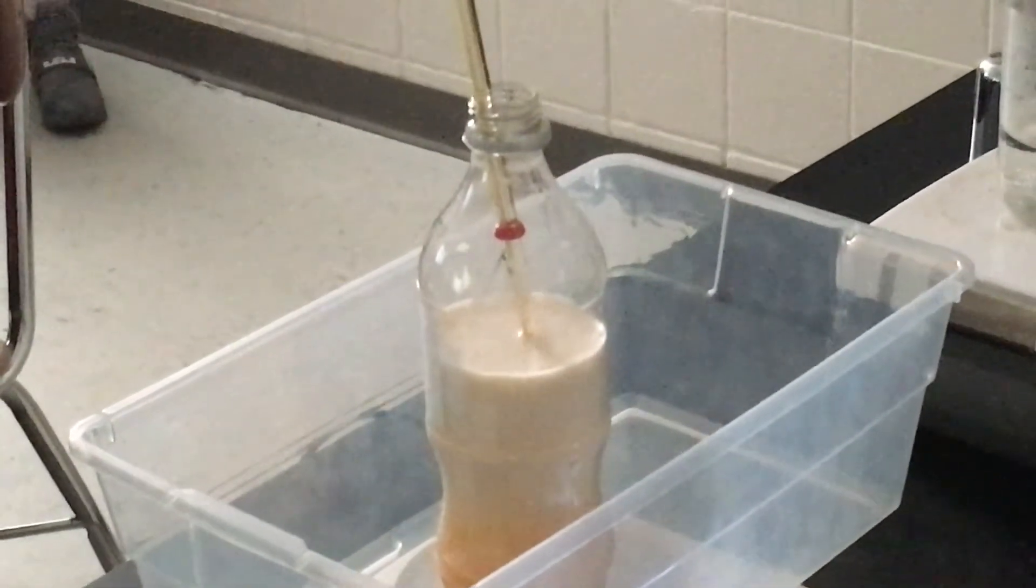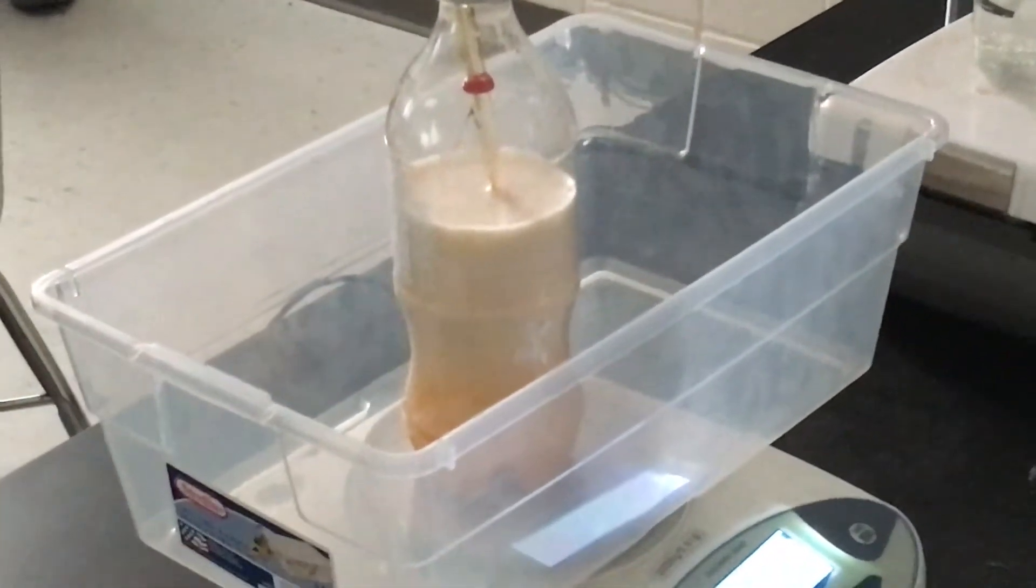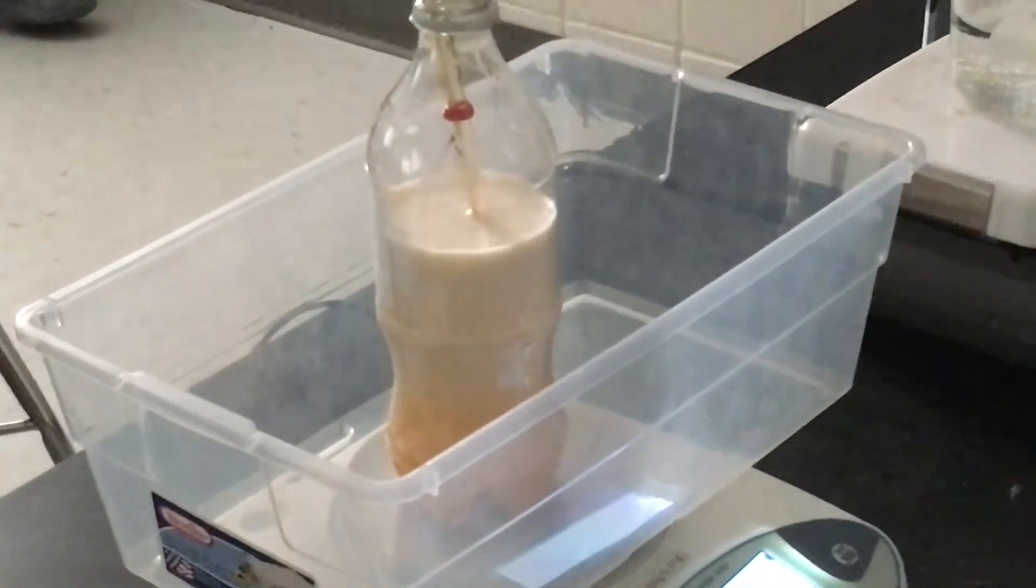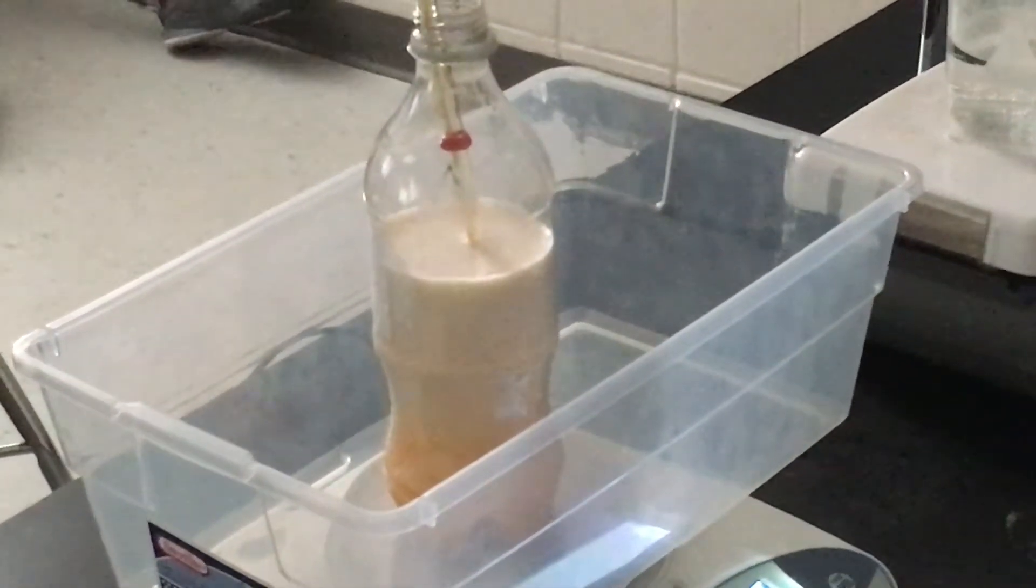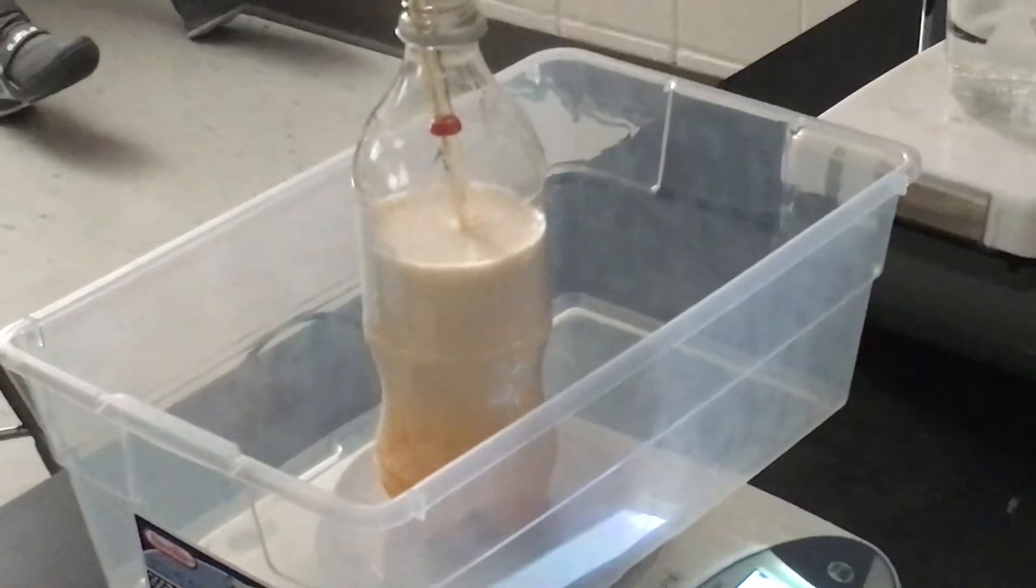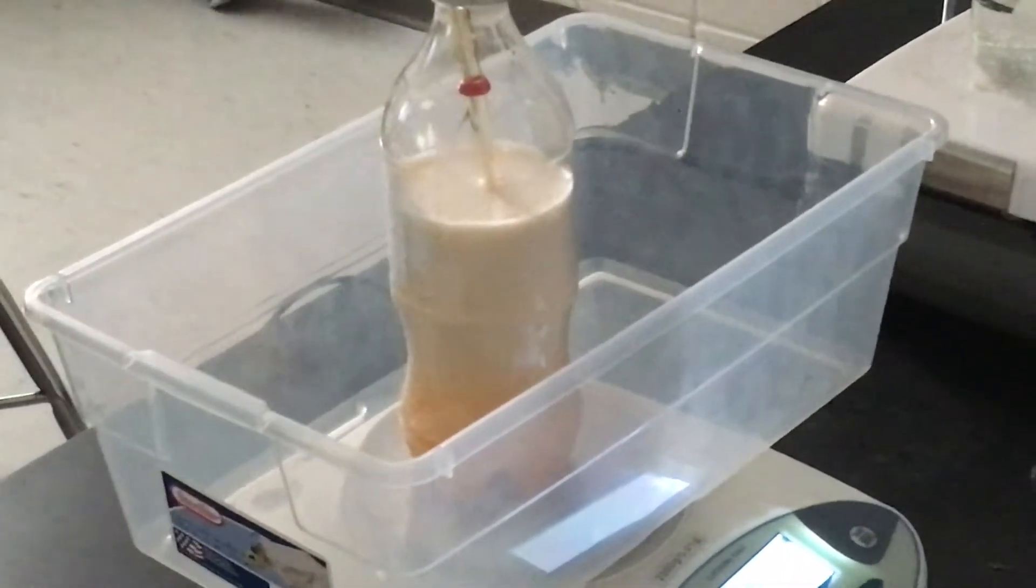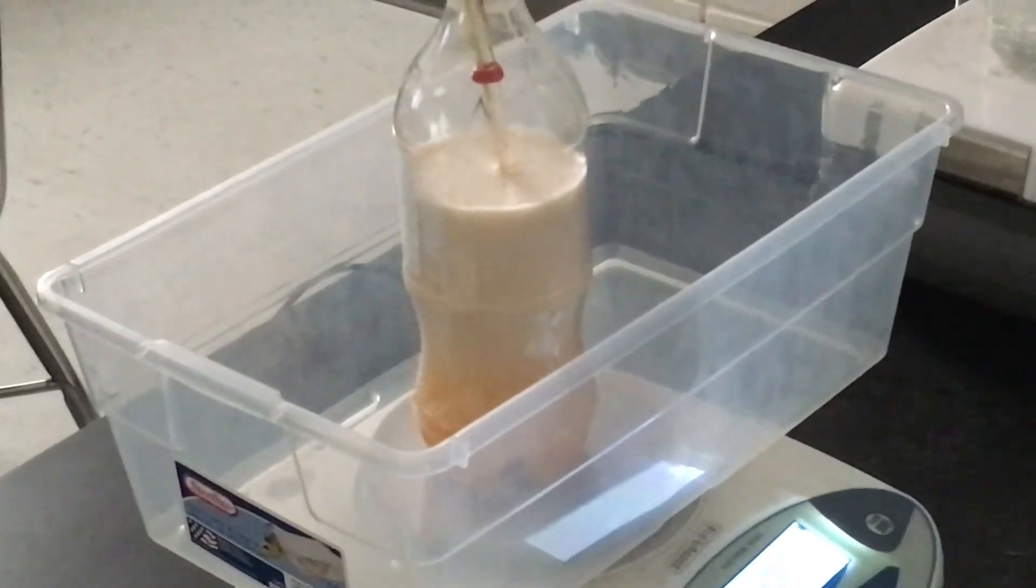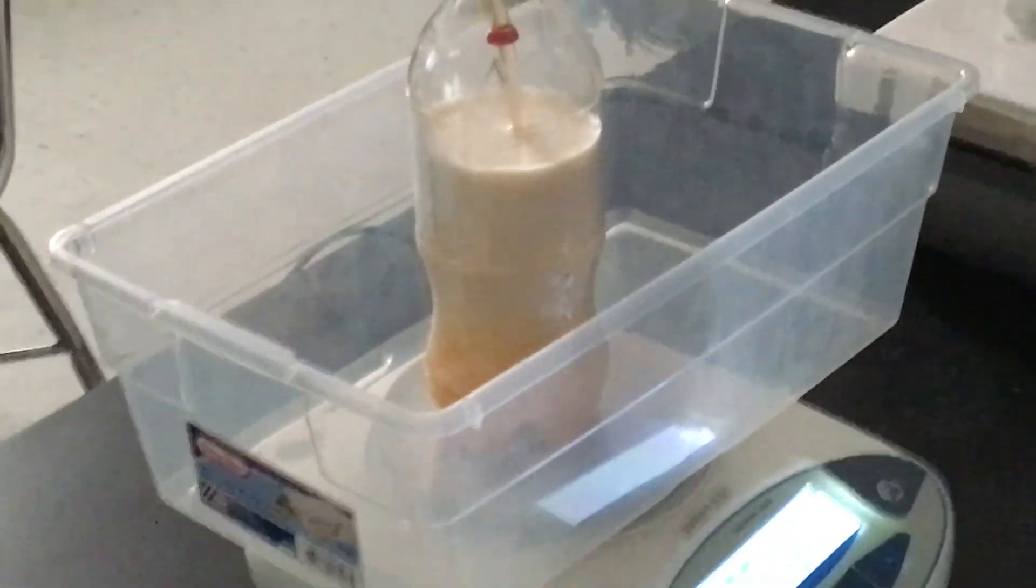Notice the volume has changed though. And it's up to 22 degrees. We're going to stop that.